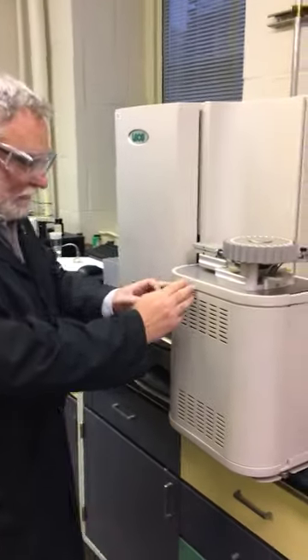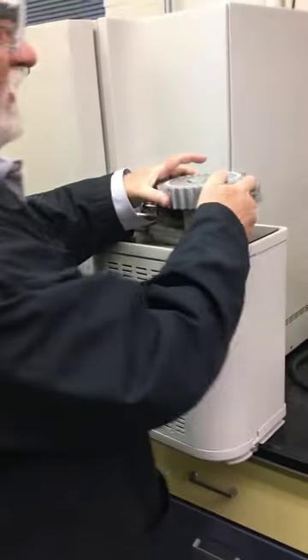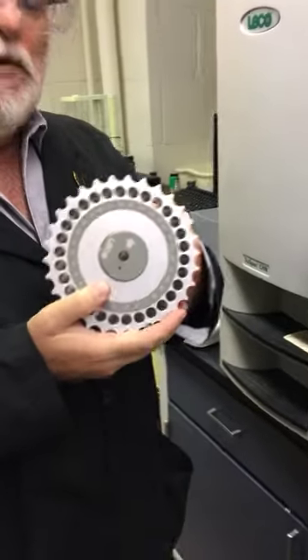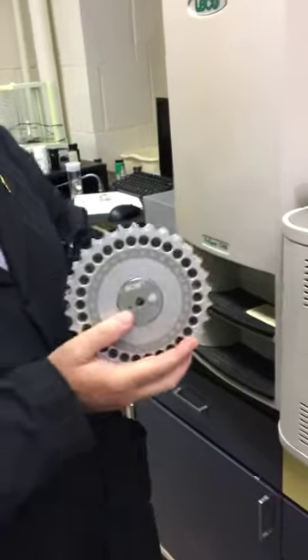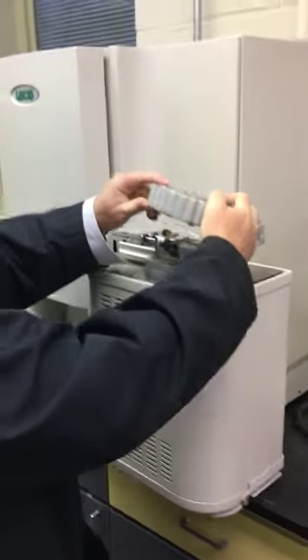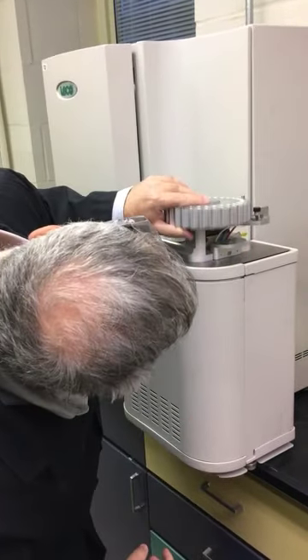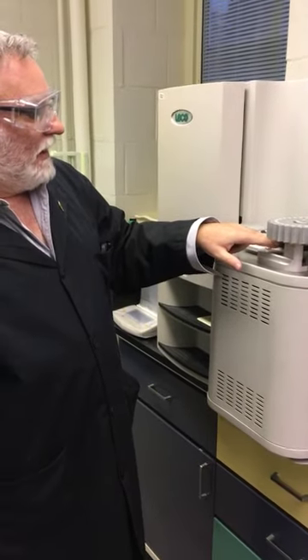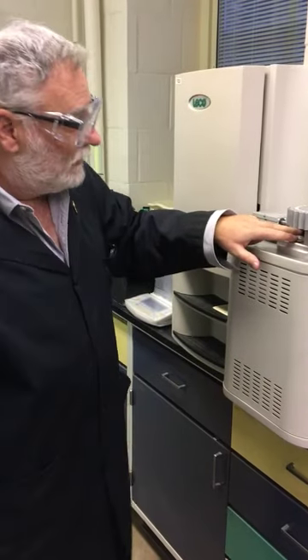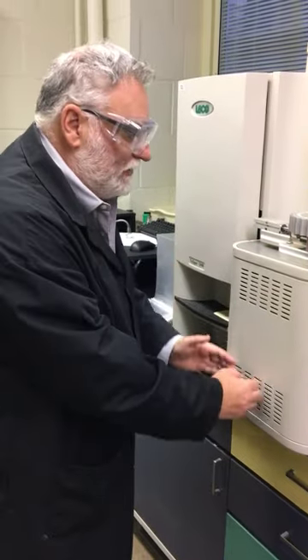What we have here is a primary furnace and a secondary furnace. We put samples into this auto feeder. Again, we can't just do one sample. We're going to do at least triplicate analysis, probably more. And so we have samples that will fit into an aluminium ball that will sit in here. This system rotates, and as it rotates, the sample will drop into this loading mechanism that is brought over into a shelf above the furnace.